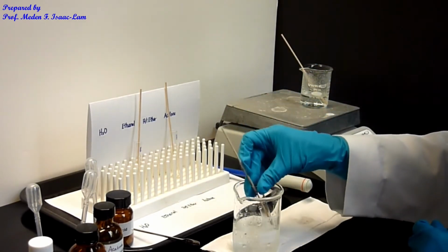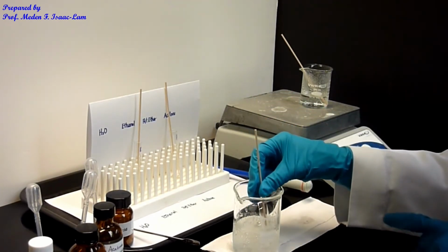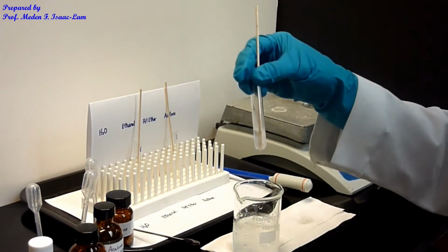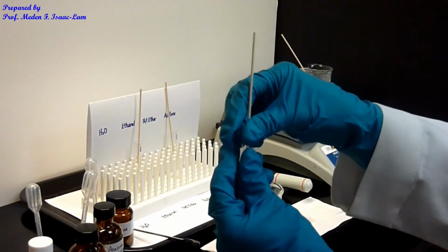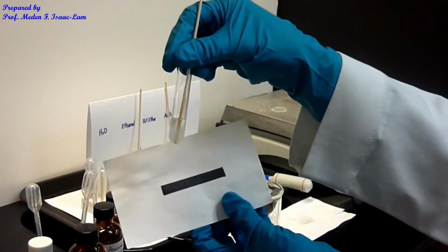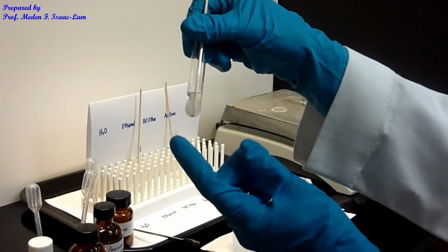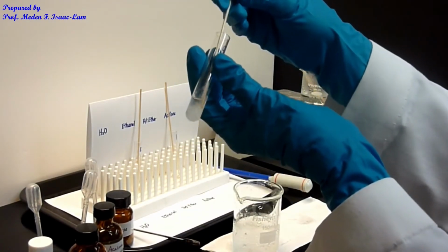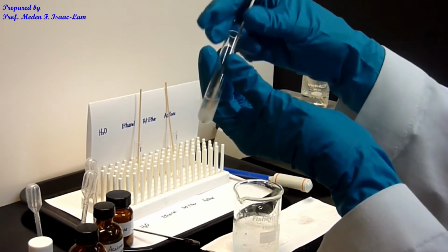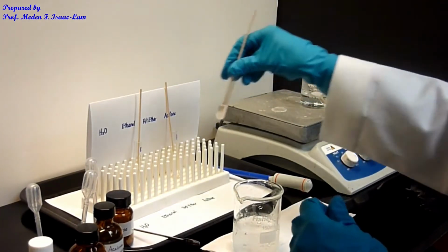So now, after I chilled it in an ice water bath, you can see that I can crystallize out the benzoic acid. It is coming out of solution. Okay, so you can see the crystals at the bottom over here. So it's white. I get back the sample. The benzoic acid is white.